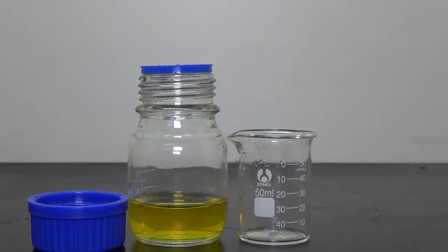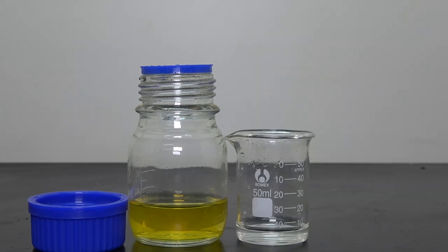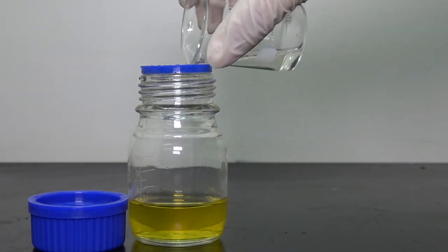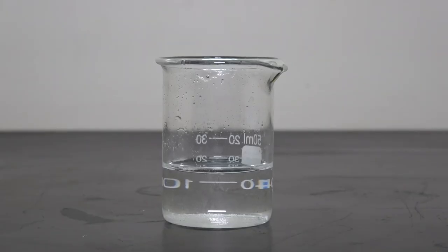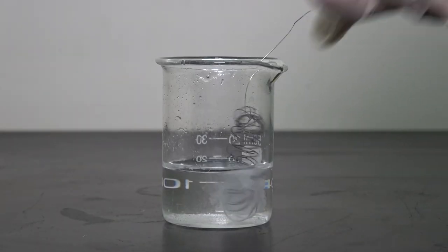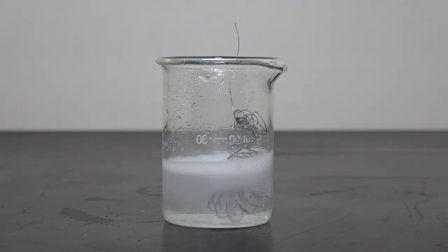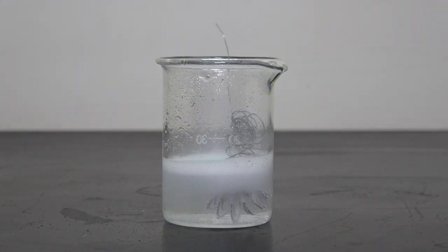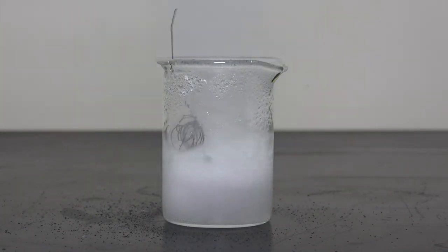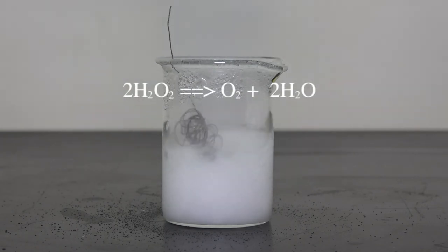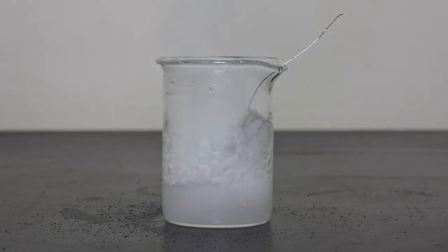For now, I don't have an exact plan for it in the future, but I would love to hear any suggestion of what project I should do with it. Now to test whether the electrode is plated with platinum, I throw it in a beaker with 30% hydrogen peroxide. Platinum is a very good catalyst for the decomposition of hydrogen peroxide. And as you can see, the peroxide in the beaker is rapidly decomposing into water and oxygen. So we have successfully made platinum-coated electrode by electroplating.